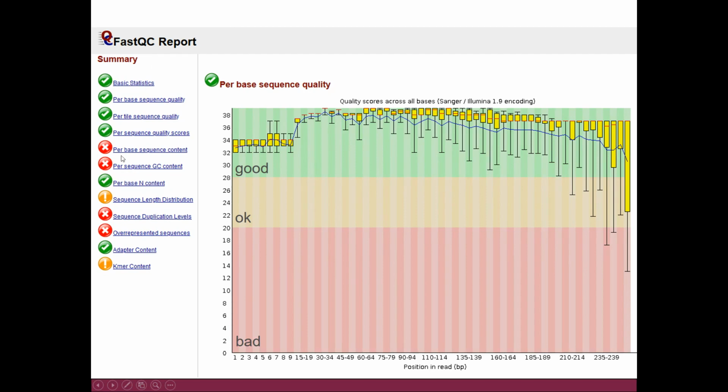Now, on the left-hand side here, you see traffic lights. These are actually links to the different plots that FastQC makes, and you can get to the particular plot by clicking here. So the first one is this per base sequence quality, which we were looking at, but there are others. And as you can see, for some of these plots, the software gives red traffic lights, which means that there is a problem, or an orange sign, meaning that it wants to warn you.